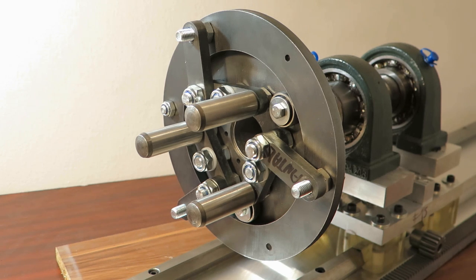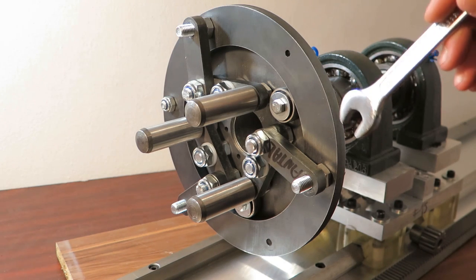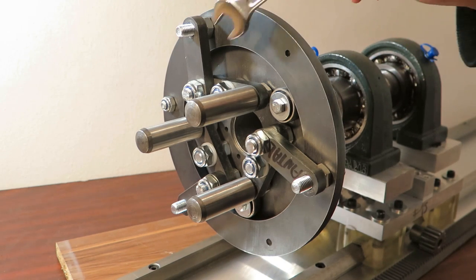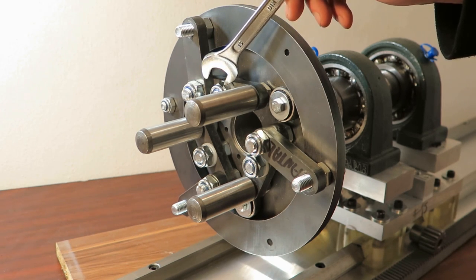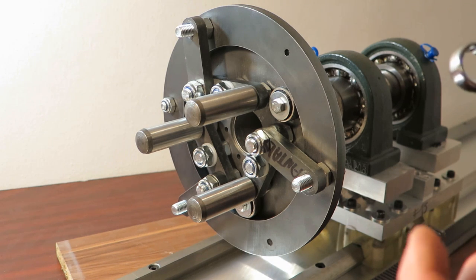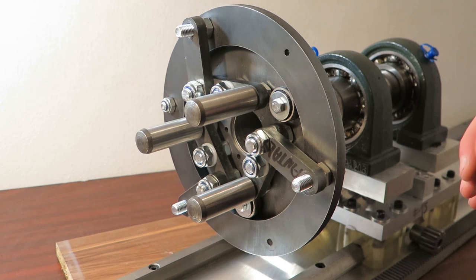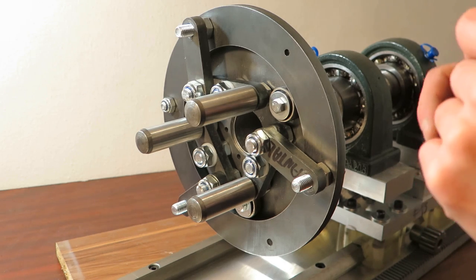Hi, so I have been working on this chuck this week, and here it is. I changed a few things on this design. The first thing is that I wanted to use pins for hinging, and I went to the store and wanted to buy a reamer, and when he said the cost of it, I was like, okay, well, I'm sure there will be another way to make this happen, and sure there is.